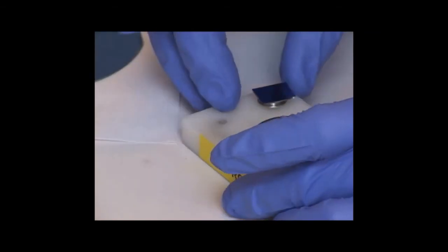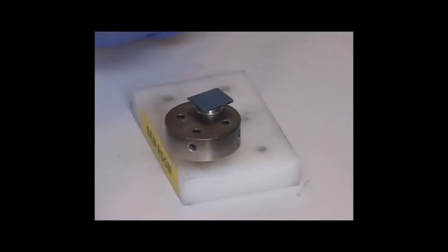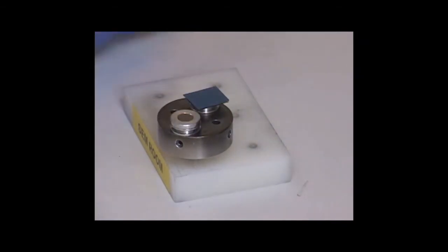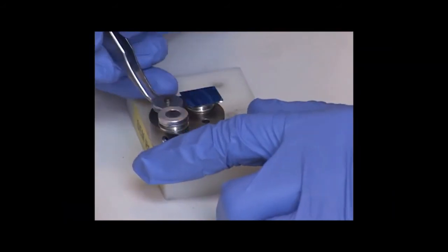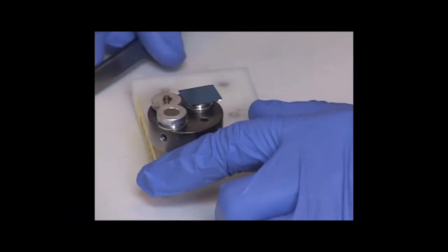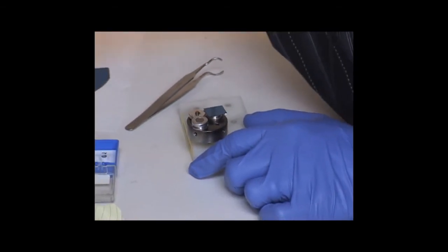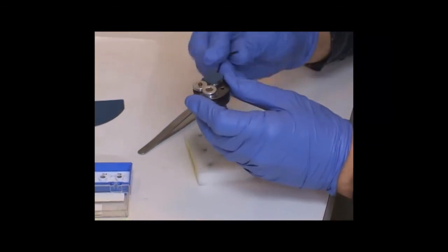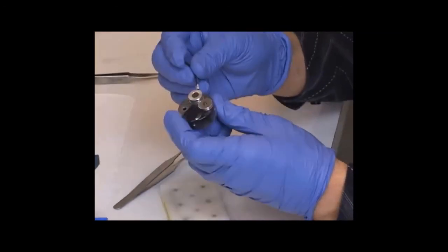In addition to loading the chip, I need 2 standard samples. First, I'll load a gold nanoparticle substrate because it has very good contrast and we can use it to optimize the beam before writing. It's kind of like sharpening your pencil before you draw a picture. And the second sample that we need is called the Faraday cup, and it's basically a 75 micron aperture that collects the entire beam so that we can measure the amount of current that's coming through. From that current, we can calculate the dosage that we need to expose the resist fully.